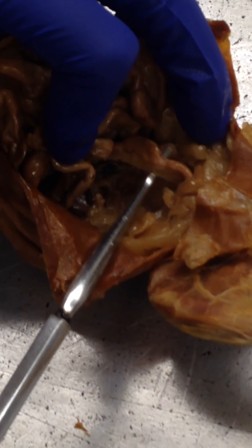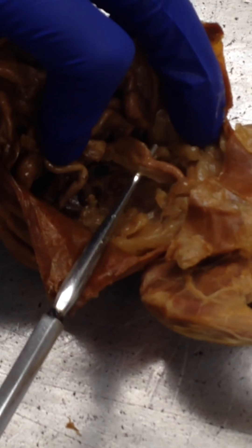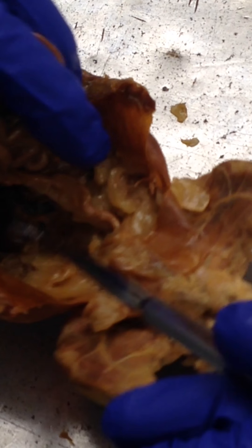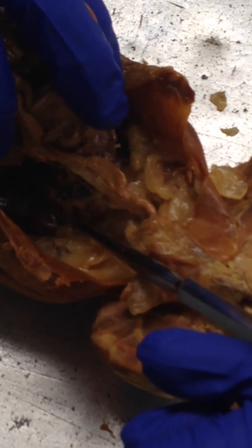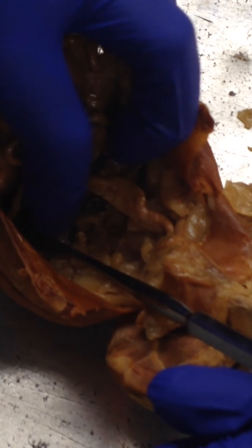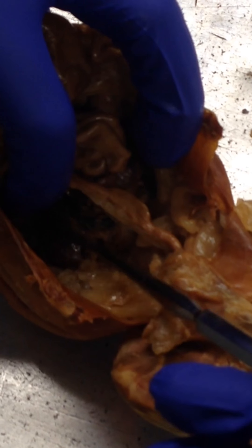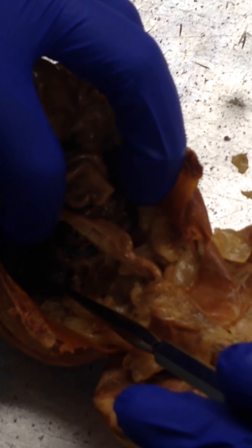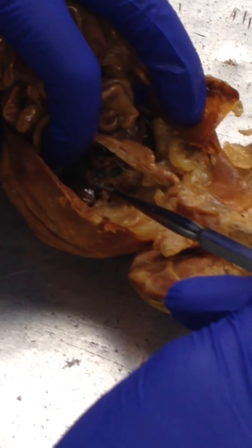This is the colon right here. The kidney is, of course, the kidney bean shape — it's right over here. Let me lift up the liver. That's the kidney. And the ureter vessel is here too.